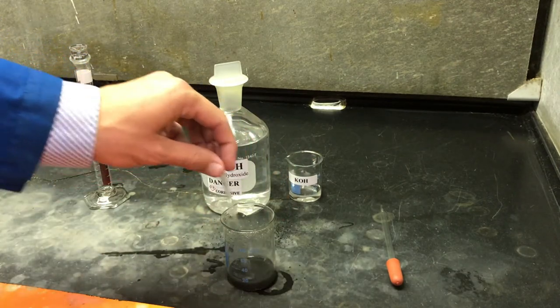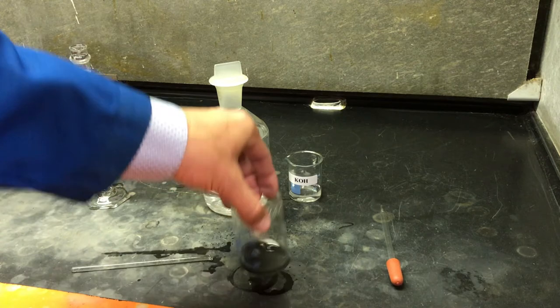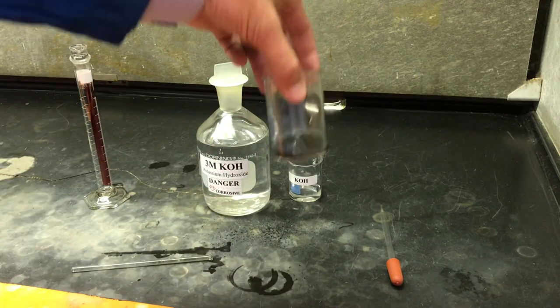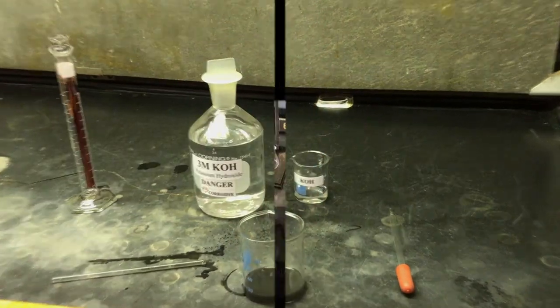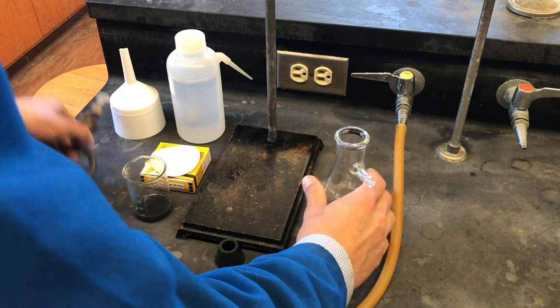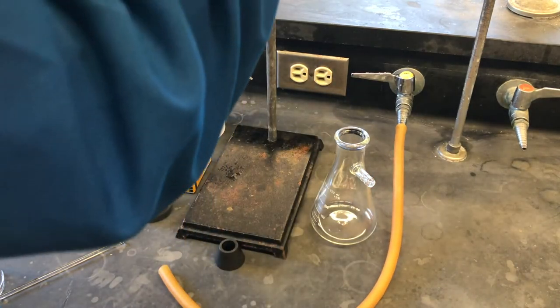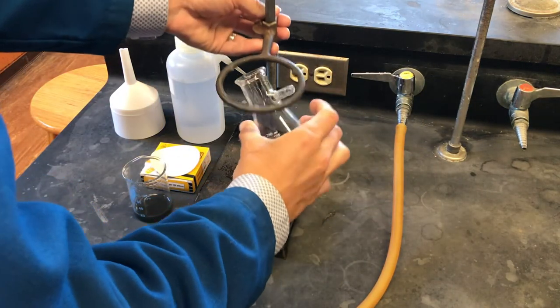The resultant solution is dark with impurities which need to be removed before progressing with our synthesis. To filter the impurities from our solution we'll perform a Buchner filtration step.